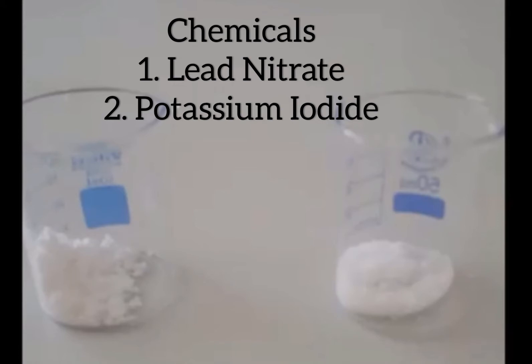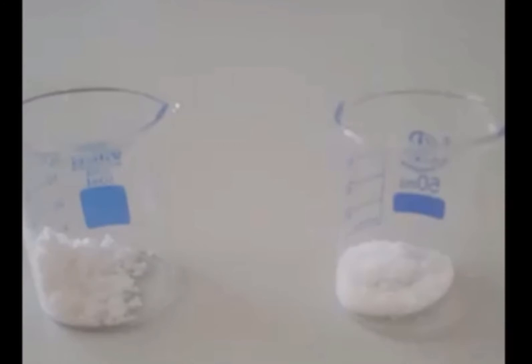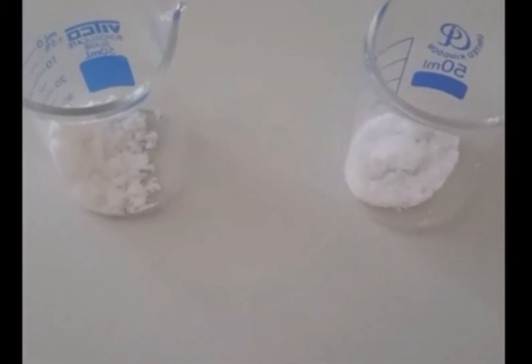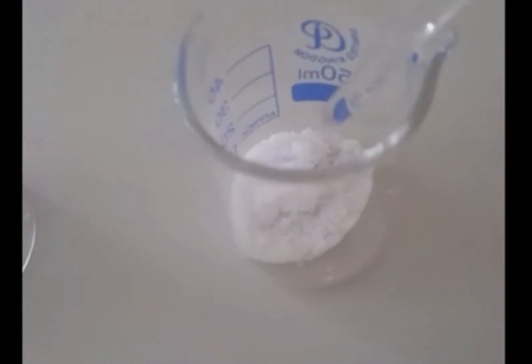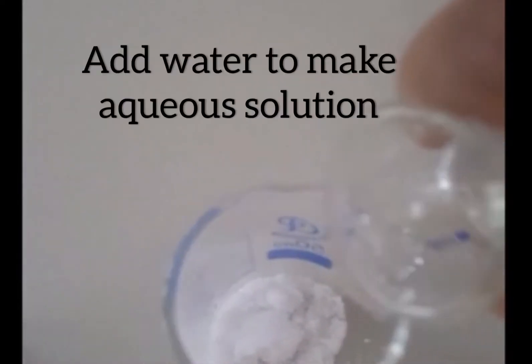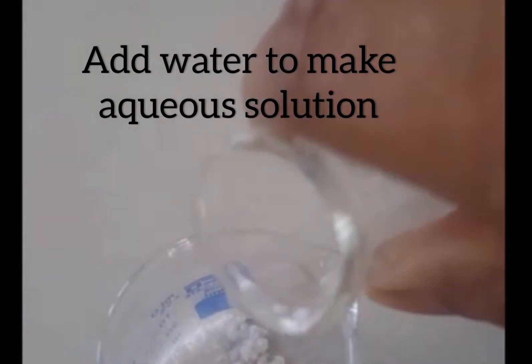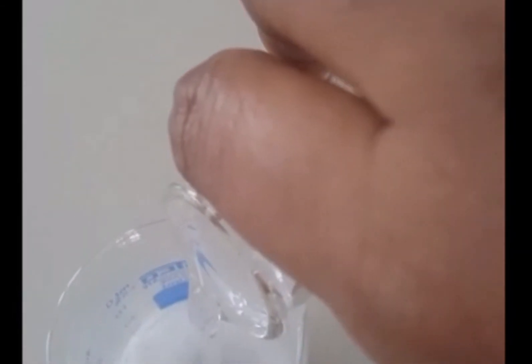The chemicals taken are lead nitrate and potassium iodide. We need to make an aqueous solution of both. The first beaker contains lead nitrate and the second one contains potassium iodide. Both are white crystalline solids. We add water to both substances and stir well to get an aqueous solution of each.